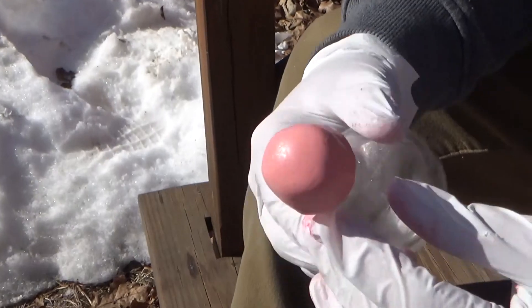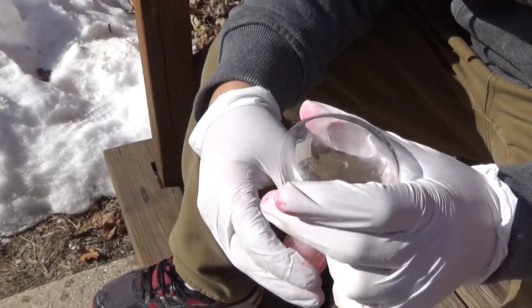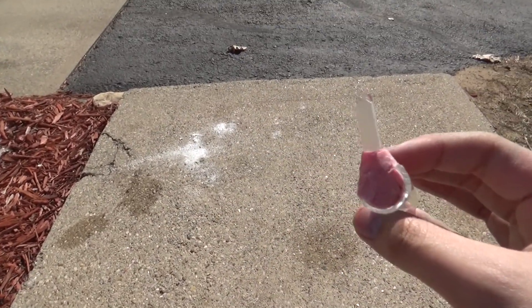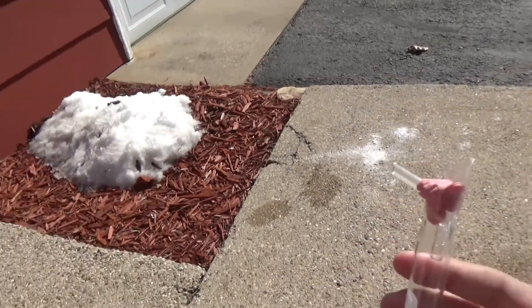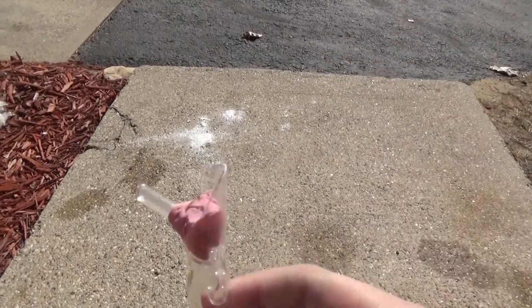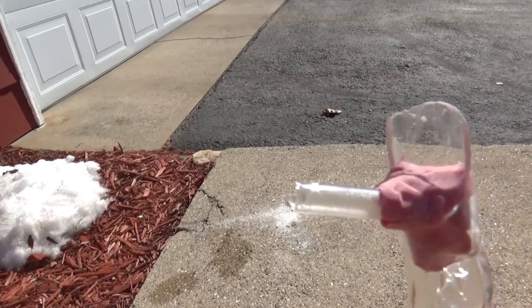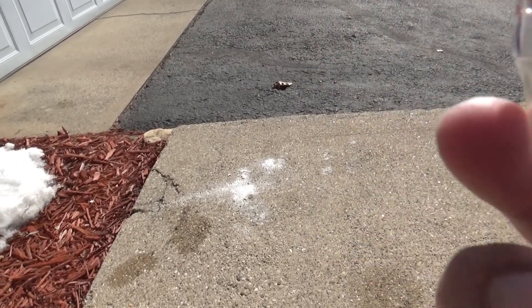I want to test: A) is it chemically resistant, and B) is it going to be airtight or watertight? I've also stuffed a little bit of proto-putty into the top of my homemade anti-backflow piece that I'm using for a different project. I tested blowing air through it — air can pass out through the side tube but can't go through the other direction. Basically airtight it seems, so that's pretty cool.